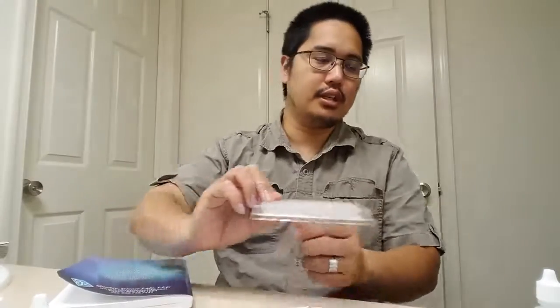Again, this is very, very diluted concentration, so I can just dump this straight inside of the sink, but I use lots and lots of water because I don't want to do anything bad for the environment. And then what I always like doing is, there it is.